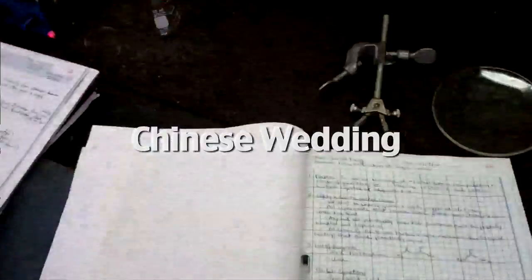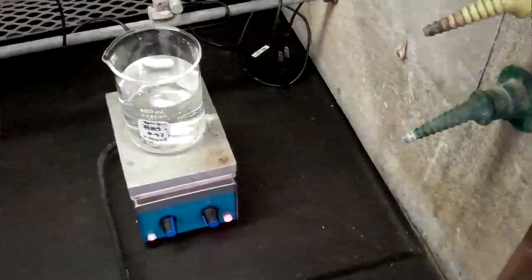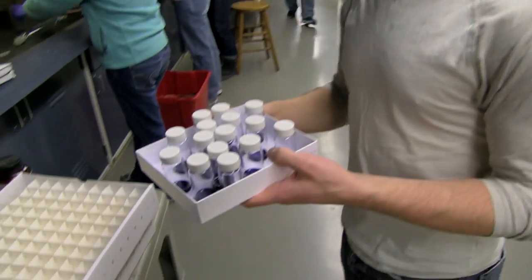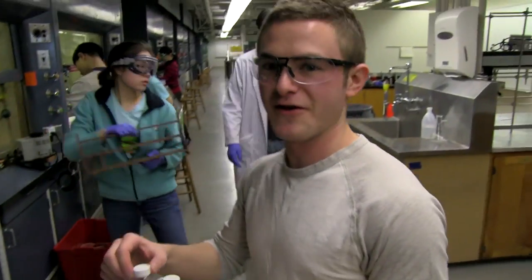So far in 5.301, the students have learned many of the techniques that organic chemists use every day. Today they'll learn column chromatography. It's the last technique before their original research project next week.